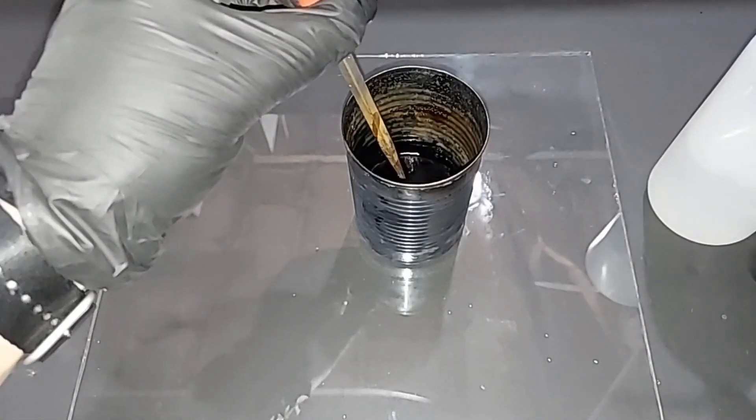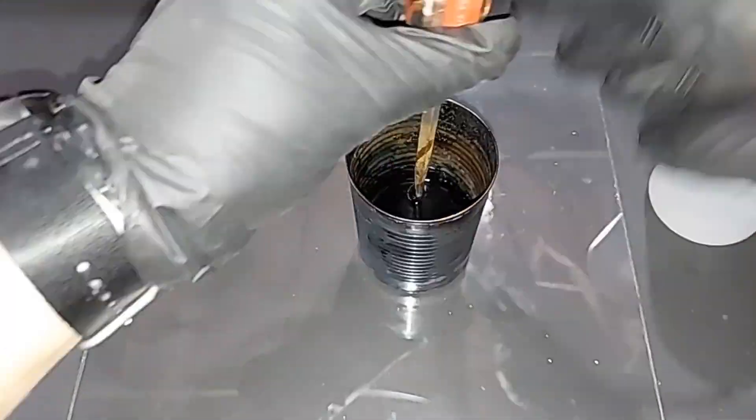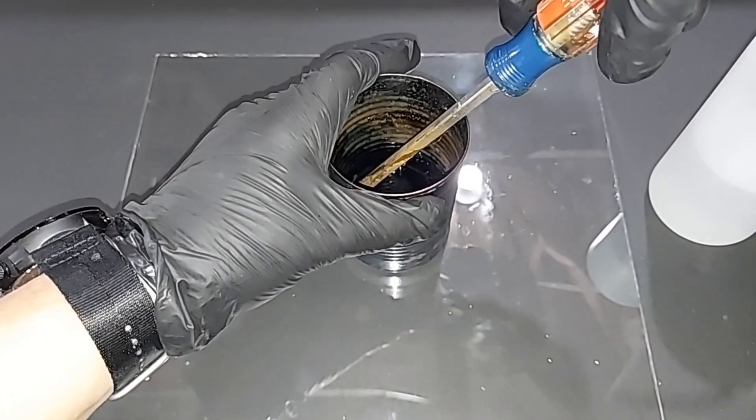What I think I'm going to do is put more water in here and just let this sit and soak in. That's probably 20 or 30 milliliters of water. I'm going to let it sit for a bit.